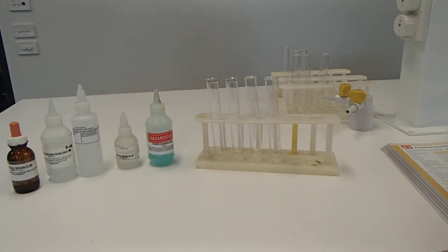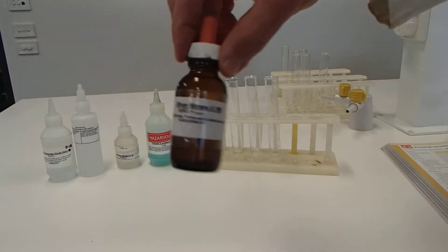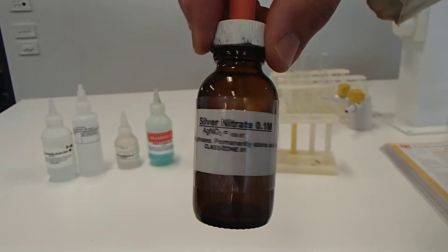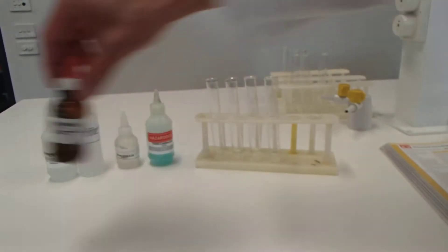So what we've got today is we've got five solutions and we're going to be testing each solution against every other. We have here sodium, sorry, silver nitrate there. So hopefully you can see that in the camera, silver nitrate.